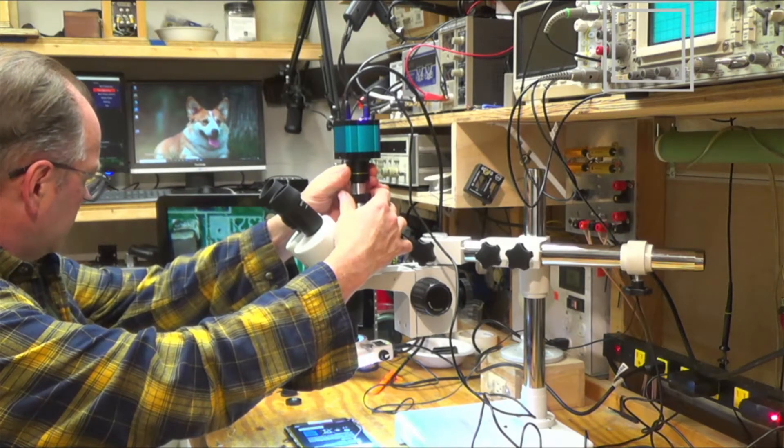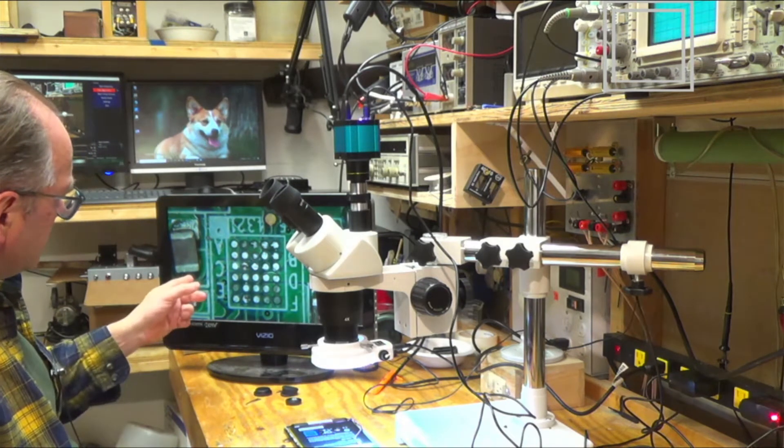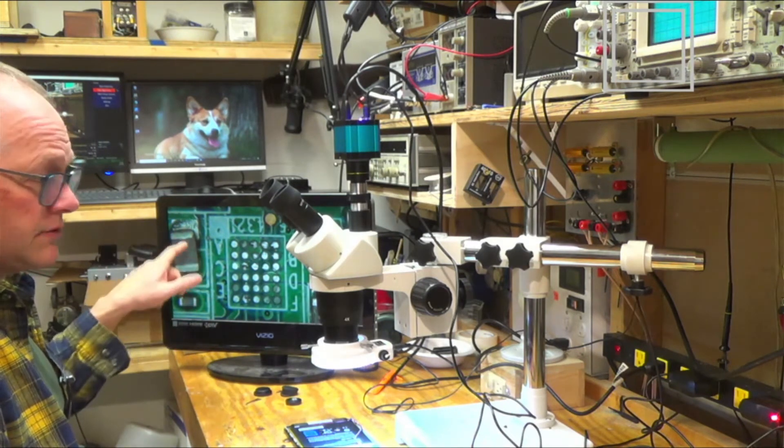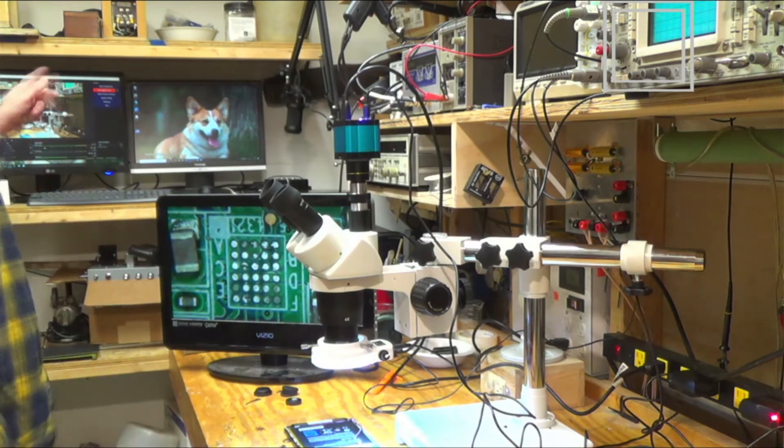And look how nice that image is, right? And that looks great. So now let's take it and let's put it right into our collection, right into the computer.